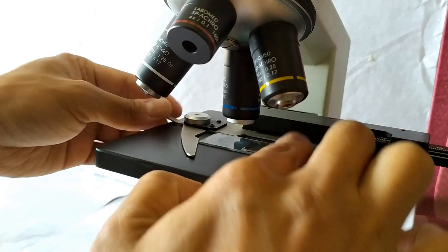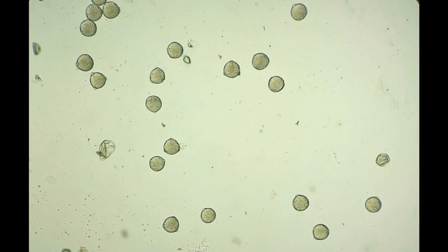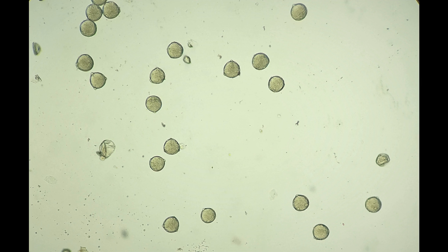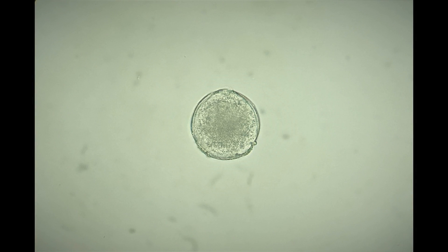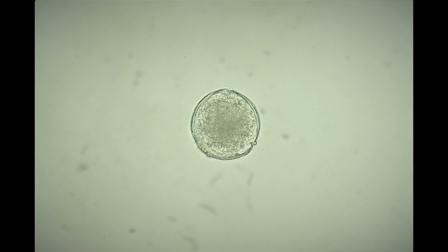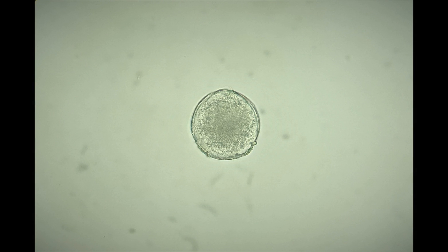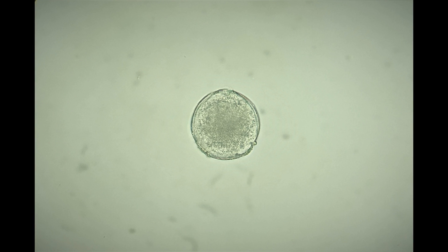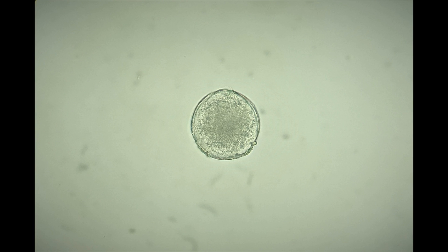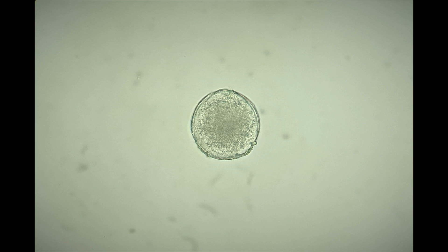Observe the slide under the microscope. You'll notice numerous pollen grains suspended in the sucrose solution. Observe one of the pollen grains under high power of the microscope. You can clearly discern the exine and intine layers of the pollen grain along with the pollen grain cellular contents. You may also notice a large tube nucleus along with a smaller generative nucleus.